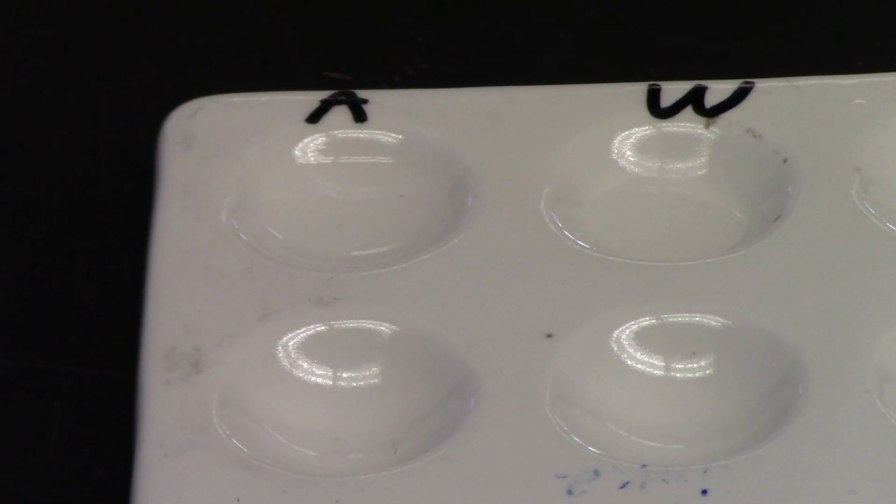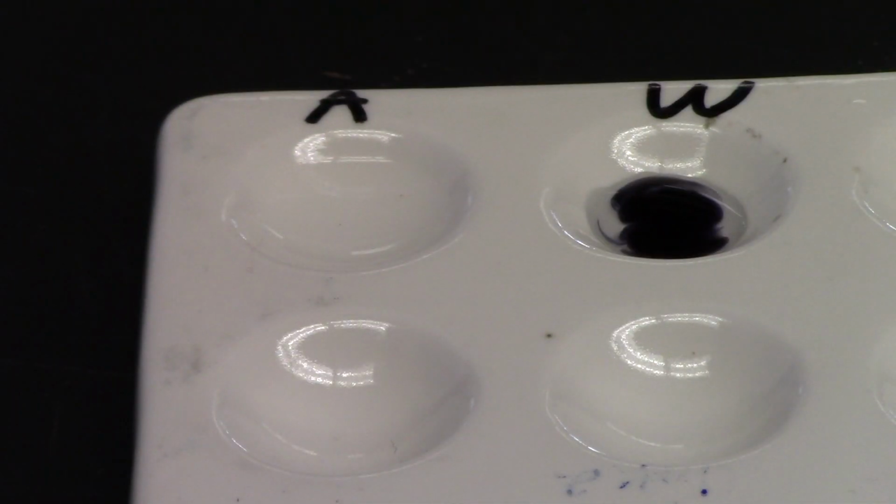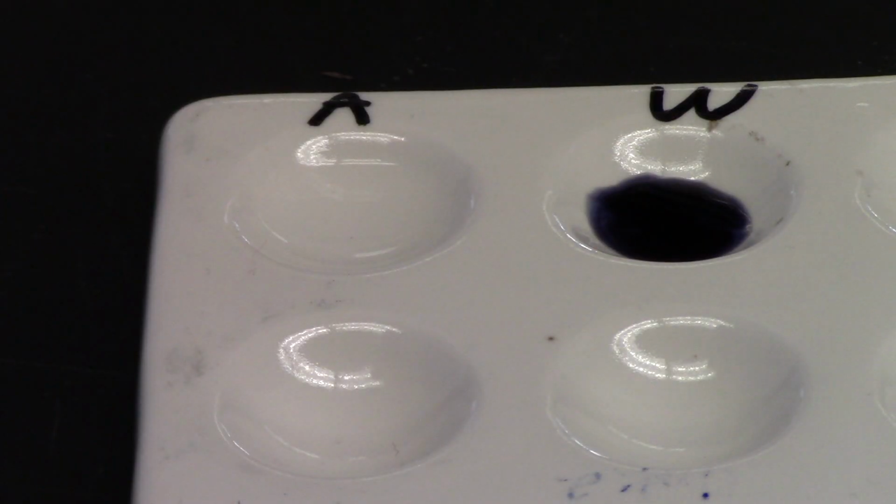Iodine solutions are known to turn black or dark blue in the presence of starch. So this is actually a test for starch. If the solution turns dark blue or dark purple or dark black, we know that there is starch in our solution. So let's try the water one first. There we go. 1 drop, and as you can see, it turned black. So there's definitely starch in the water. So we started with starch, we added water to it, and we heated it up. So nothing happened, essentially. The starch is still there. Let's see what happens in the acid.